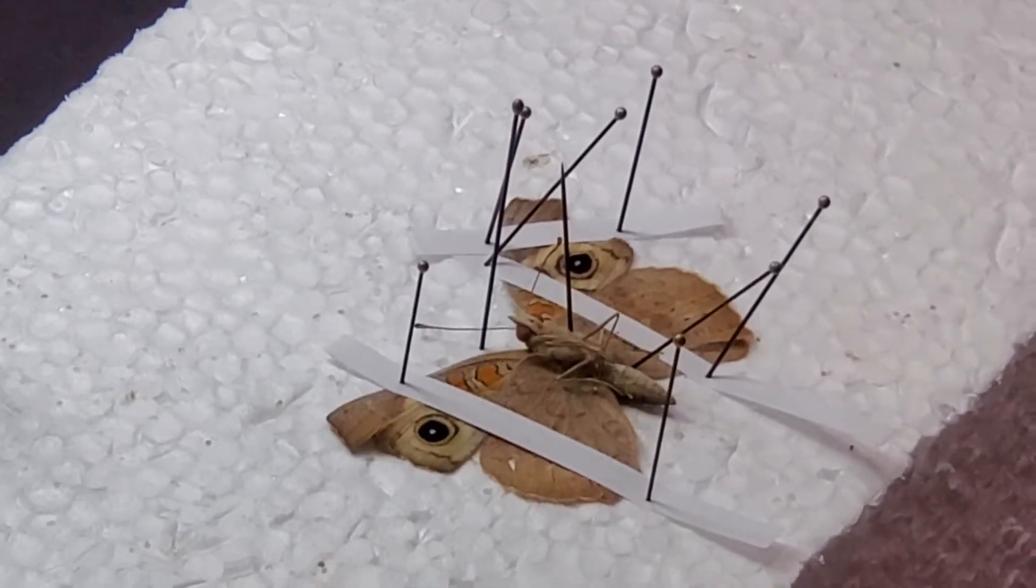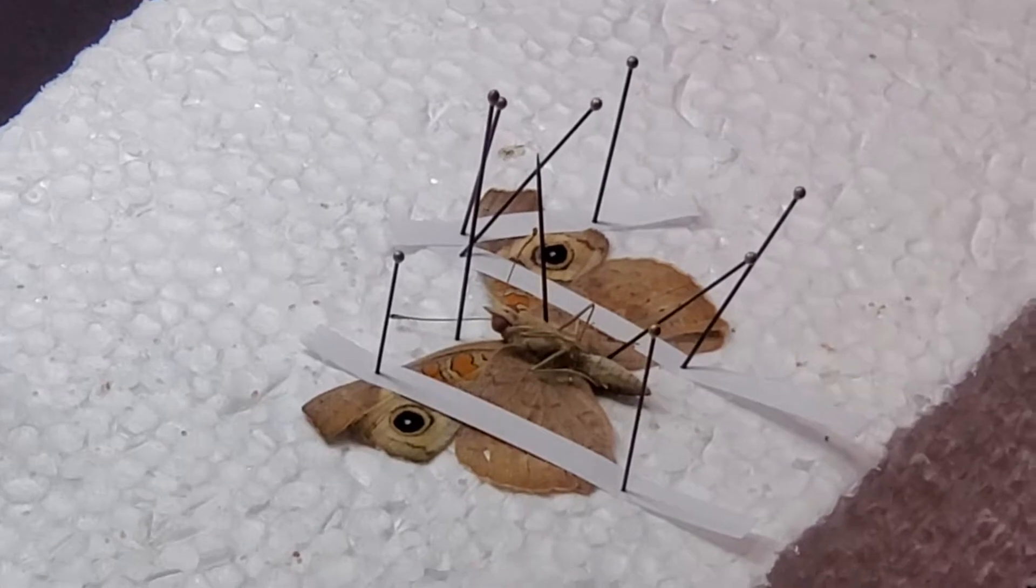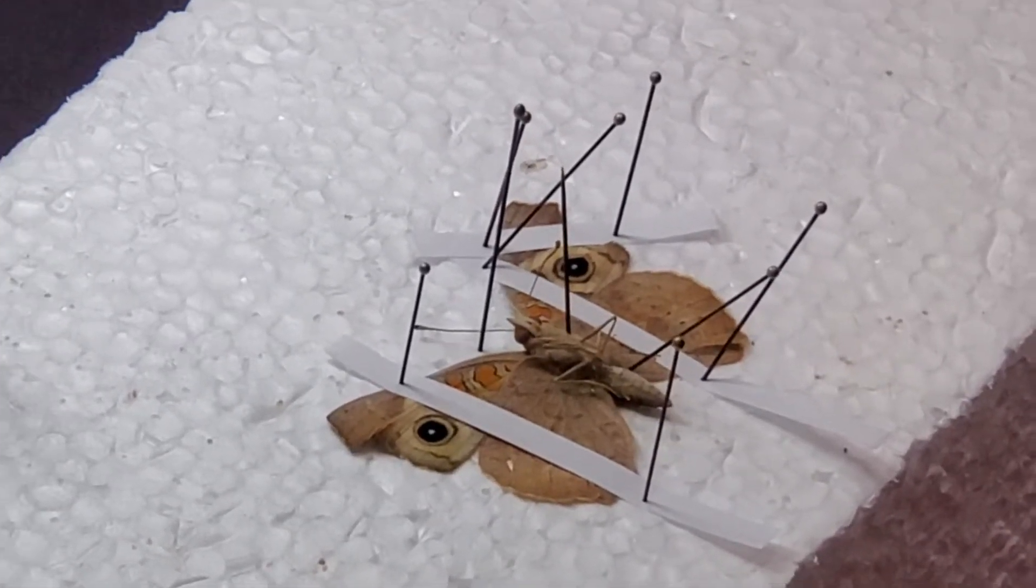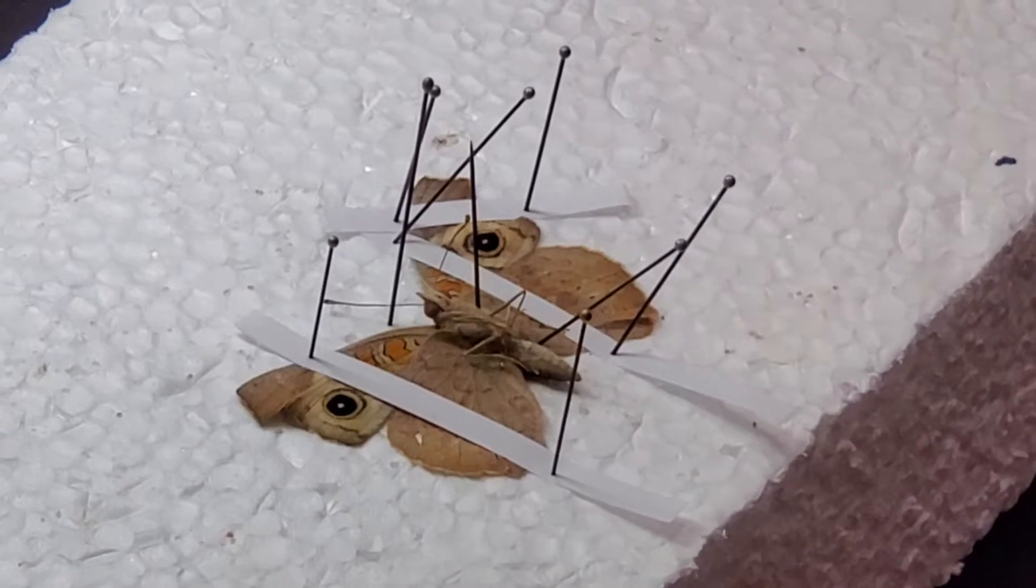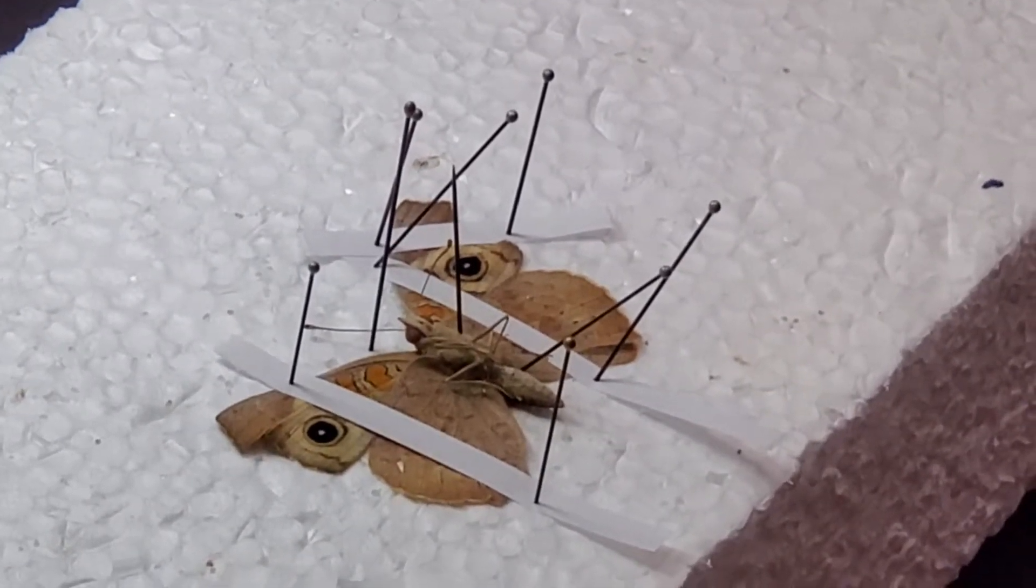How many pins do I need? Good grief. Well, every piece of paper will have a minimum of two pins, a lot of extra ones. Don't be surprised if you use 20, maybe even 30 pins on a large specimen.